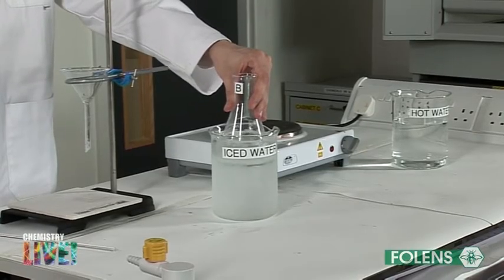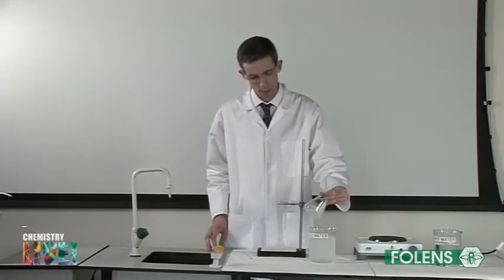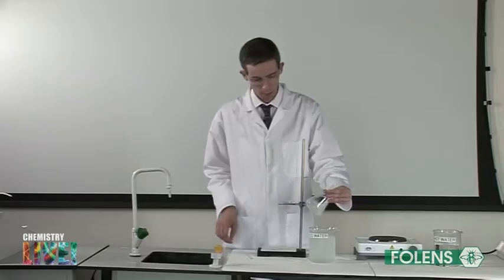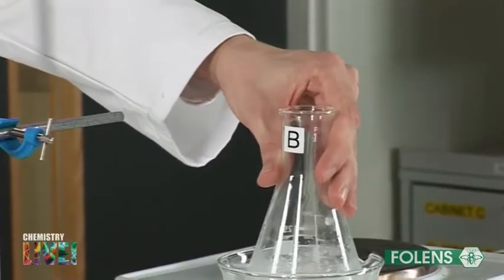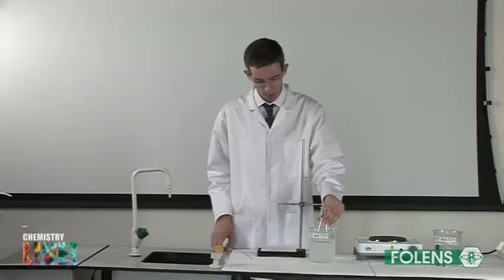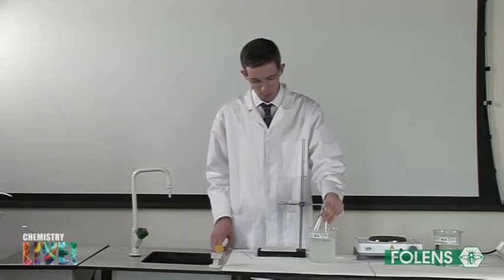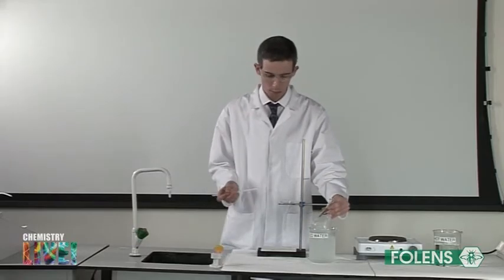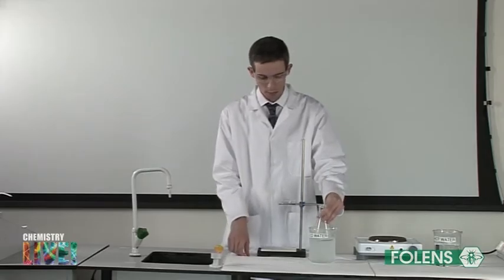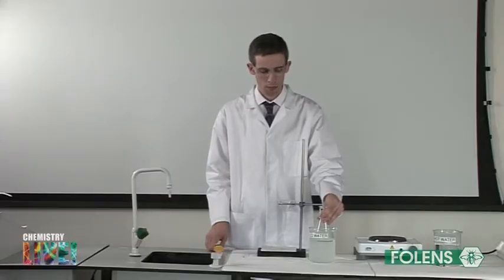The conical flask containing the filtered solution is placed in a beaker of iced water. Note that crystals begin to form in the conical flask. If crystals had been slow to form, a seed crystal of pure benzoic acid could be added to the solution. In addition, scratching the inside of the conical flask with a glass rod would help crystal formation. Also, some of the solvent could be evaporated and the solution allowed to cool again in order to help the crystals to form.